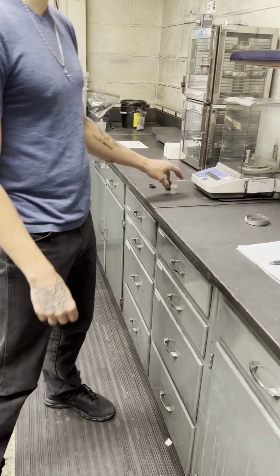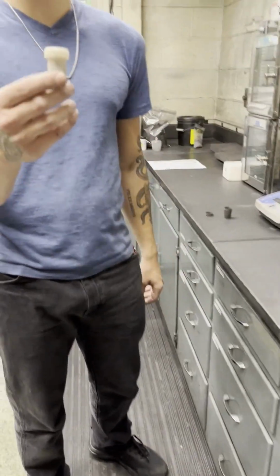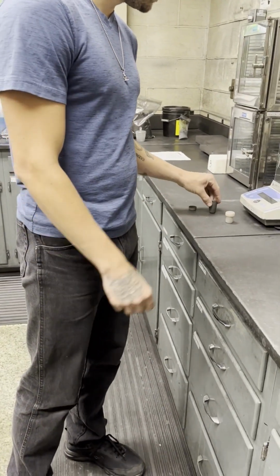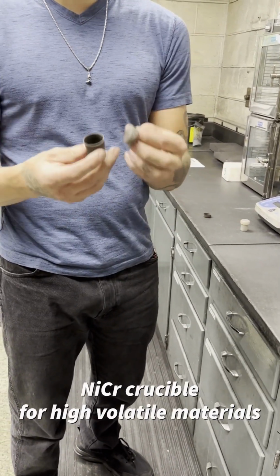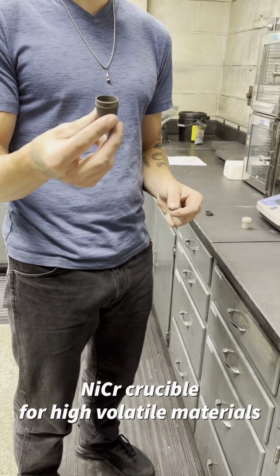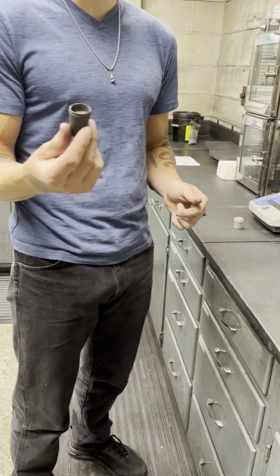We determine the volatile matter content by using a quartz crucible with a lid. Alternatively, there's also a nickel chromium crucible with a lid you can use. This would only be used for a higher volatile material such as amorphous graphite or a green petroleum coke.